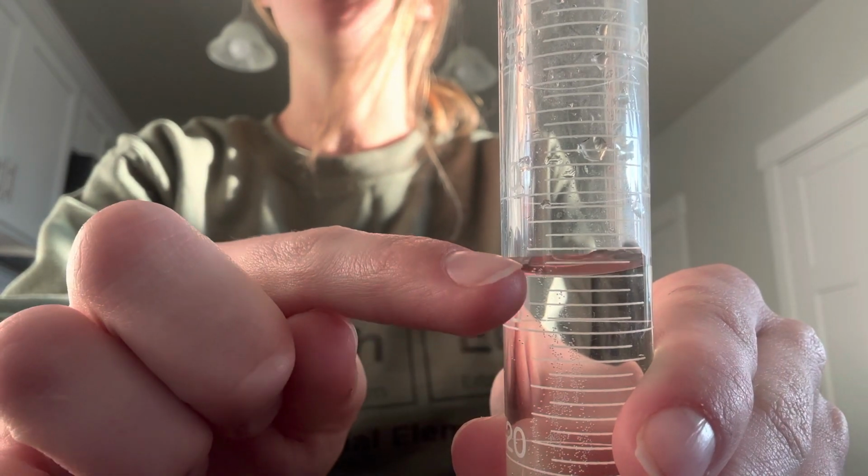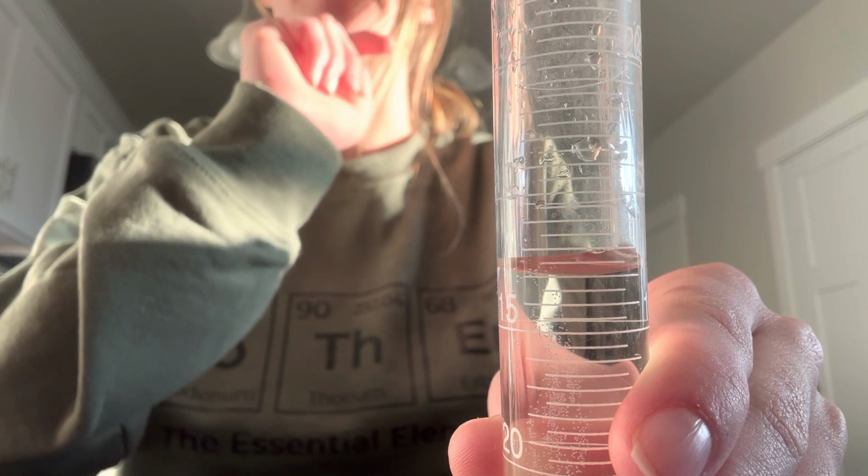Then when you're eye level with it, you want to make sure you see how the water line is kind of thick and it curves down a little. You want to make sure you read it from the very bottom. So that bottom part is what you're reading, not the top part.